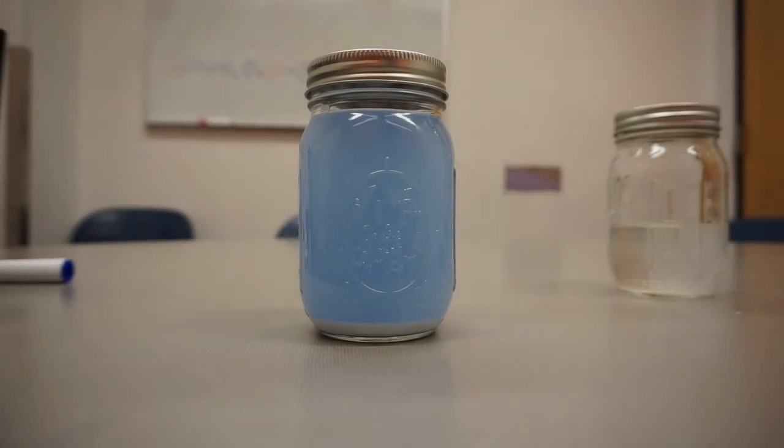It's obvious that precipitating metals out of an acidic solution is possible, but scaling to treating acid rock drainage presents some challenges. We showed our experiment as a batch reactor, but in practice, this would be efficiently done as a continuously mixed flow reactor. In addition, the base used to increase the pH should be non-reactive, which may be difficult with unknown species in solution.